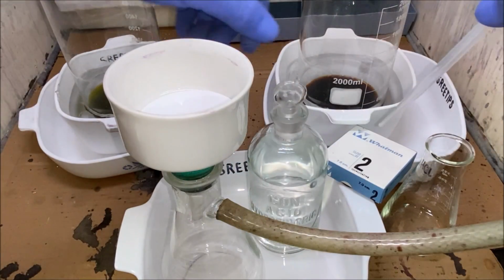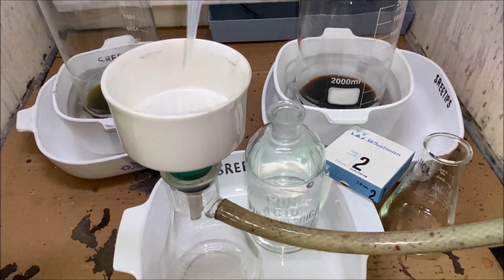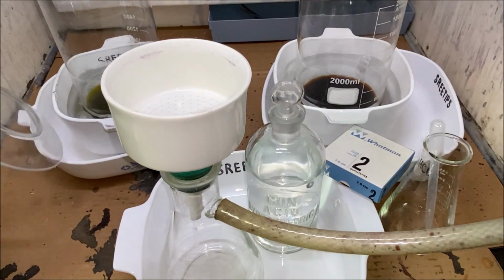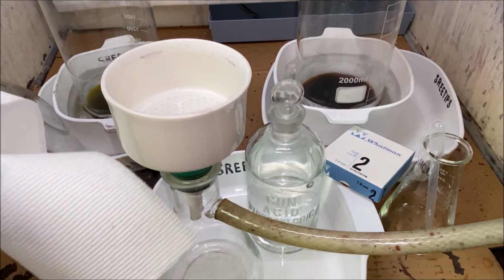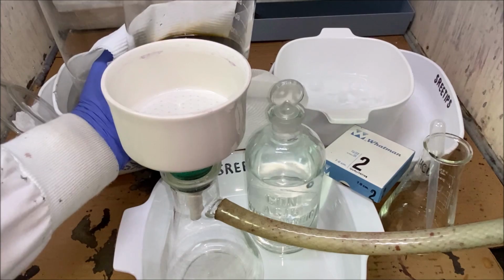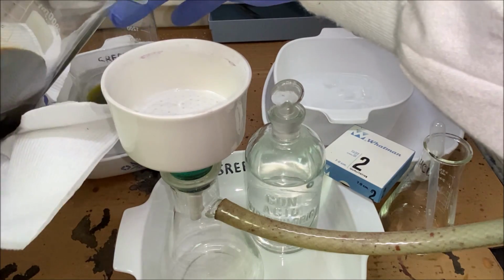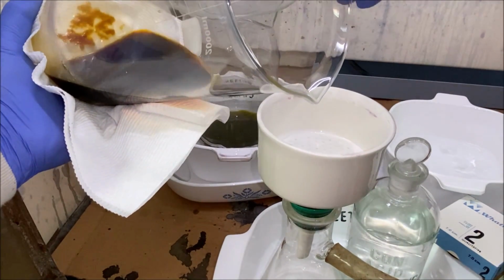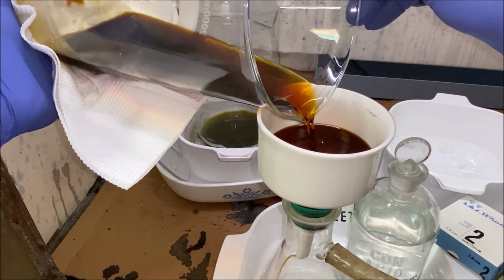I'm going to go ahead and start filtering the solutions now. I'm wetting the filter paper with some hydrochloric acid. I want to avoid using water because water forms a weird precipitate. So now we're going to take our solution here that's been chilled, and we're going to go ahead and filter this. This is the precipitate that we rendered with DMG that's been dissolved in aqua regia.